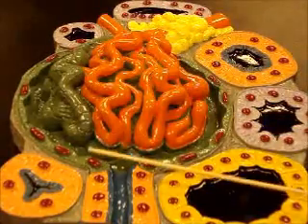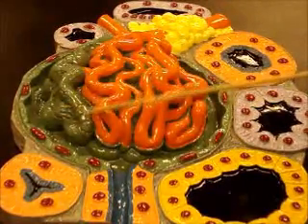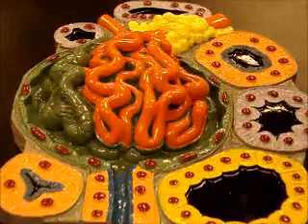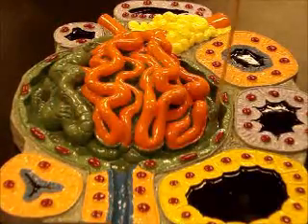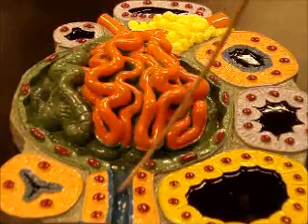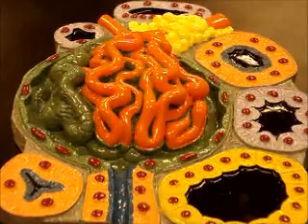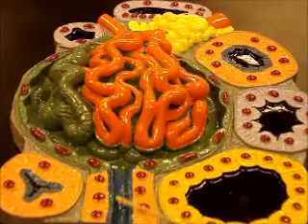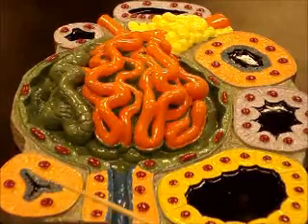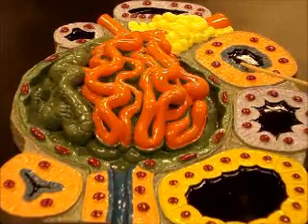This is the glomerulus. The green cells on top are your podocytes, and you have to look close on this to see the foot processes, but you can see little things coming off of there. Bowman's space, Bowman's capsule in green, proximal convoluted tubule here. And on this one it's nice because you can see the cuboidal cells and then this little blue line, which is your microvilli. This is also proximal convoluted tubule with microvilli in blue.